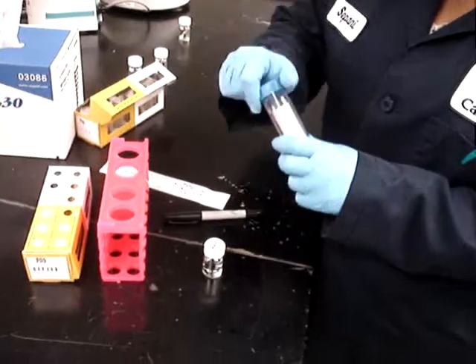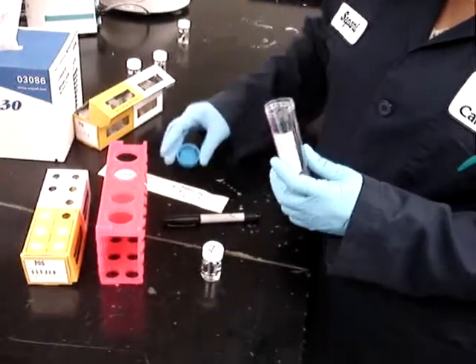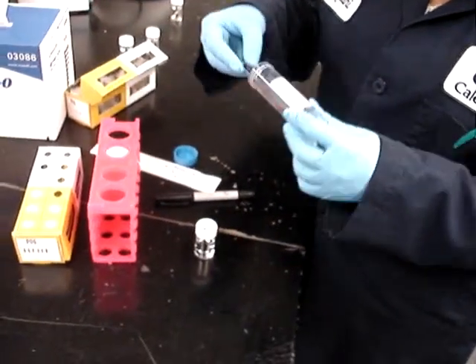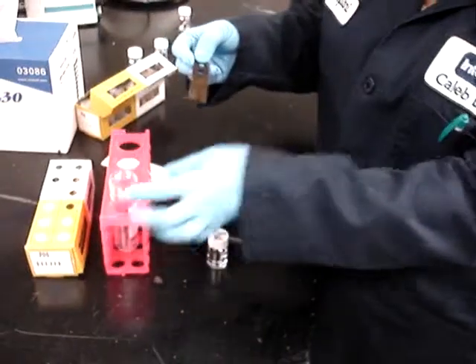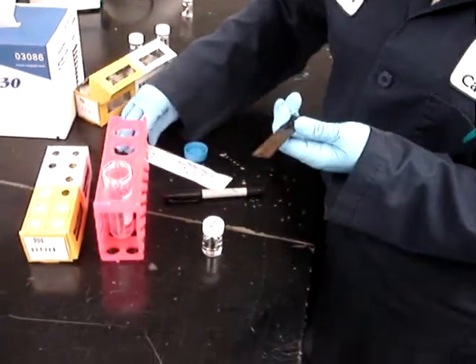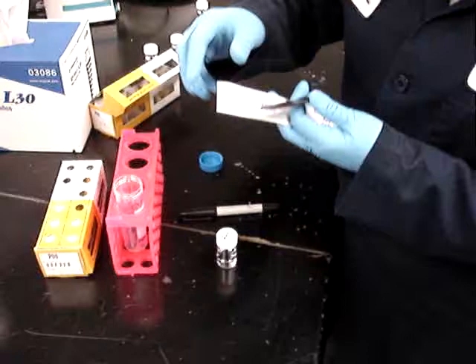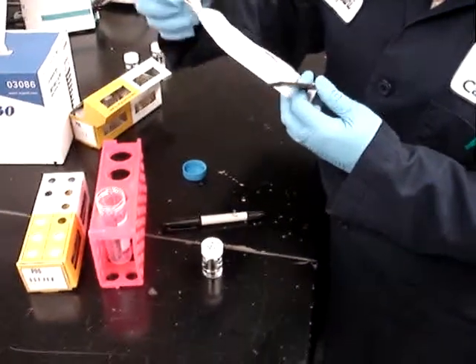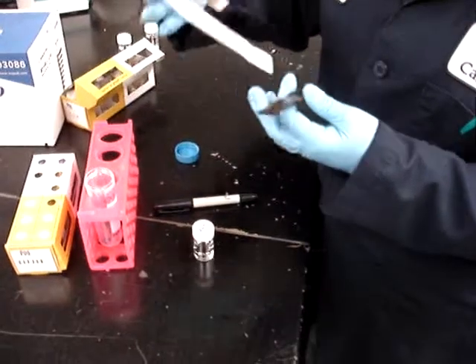The technician is going to be careful not to touch the region of the coupon that will be sampled. A sterile cotton swab is used to obtain the biofilm sample that has microorganisms and corrosion products.